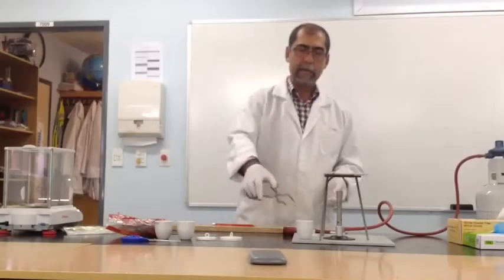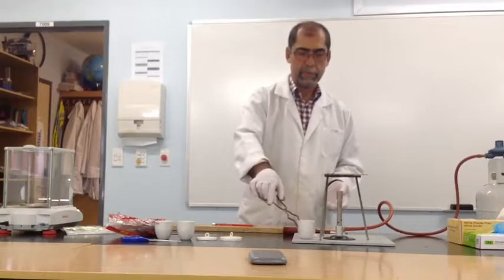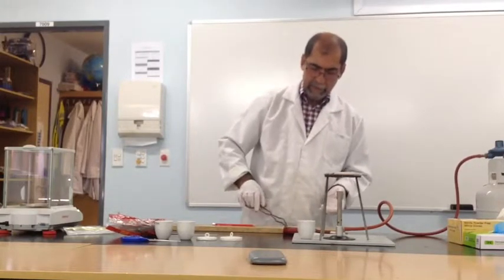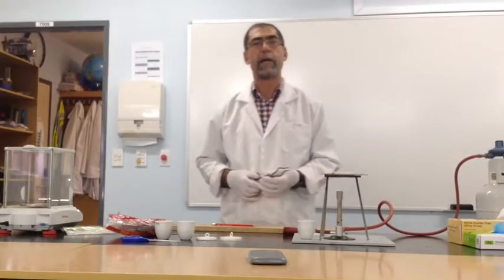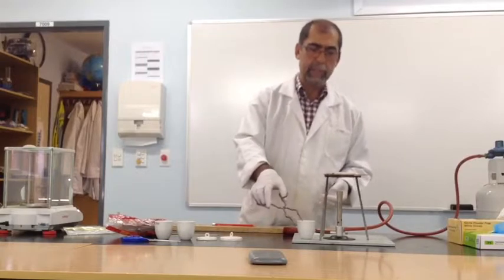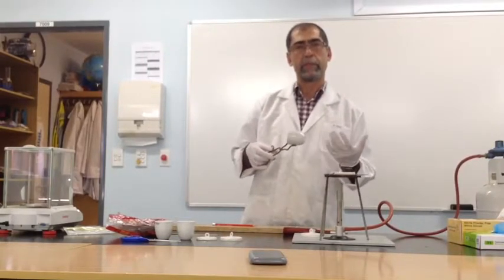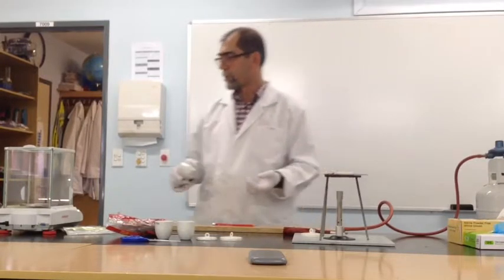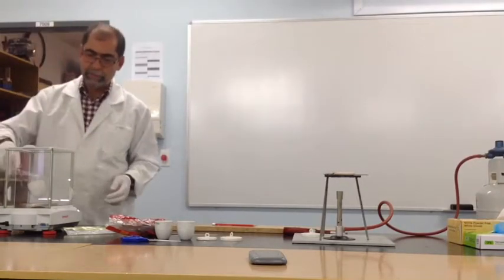See that? Okay. Now we've got a crucible and a lid that have been pre-treated, and a cleaned up magnesium strip. We're ready to start our experiment. The very first thing we have to do is establish the weight of the empty crucible plus its lid. So we'll use the analytical balance for that. It's been tared to read 0.